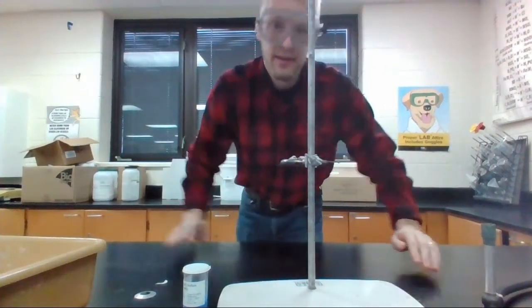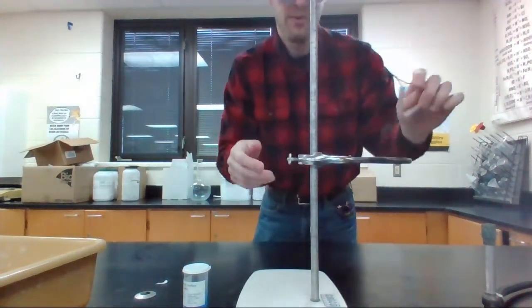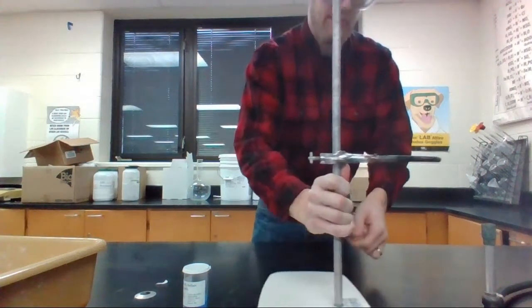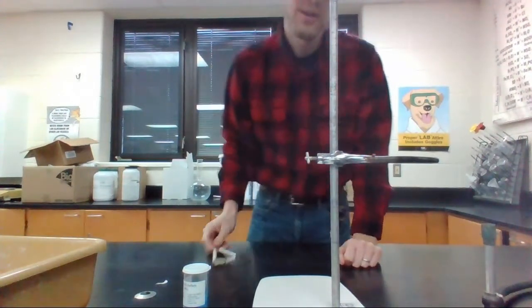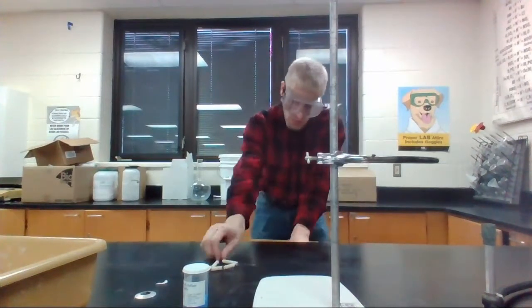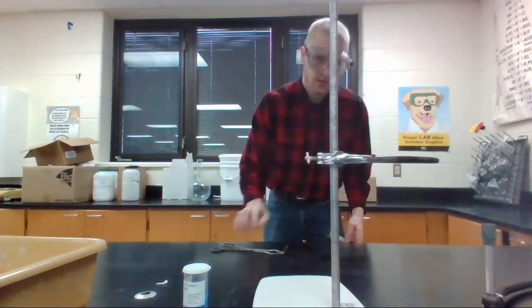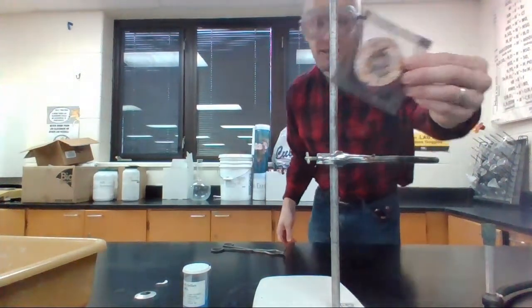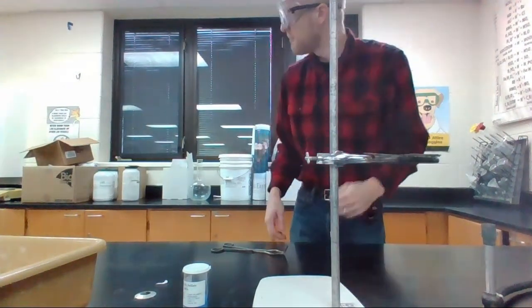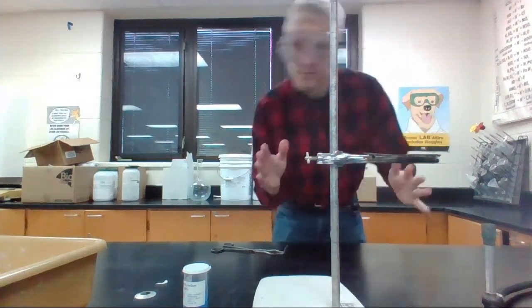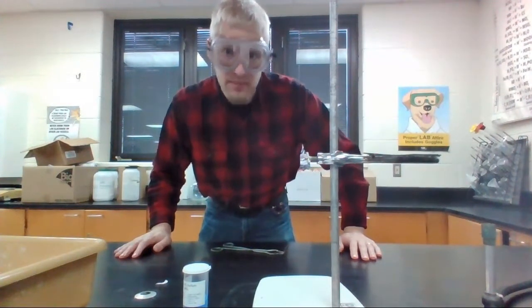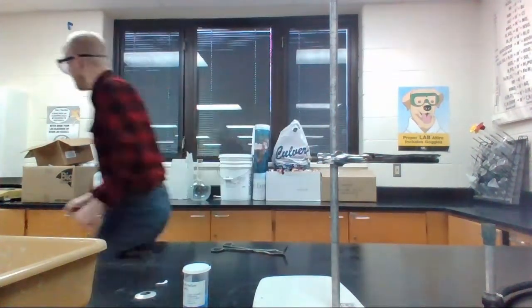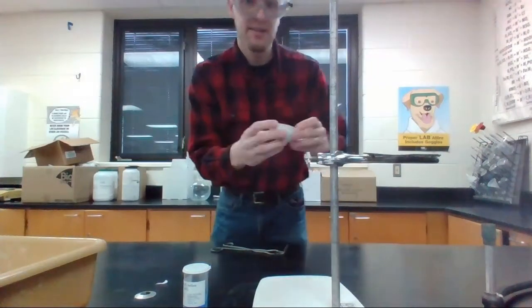Look at this setup. We have a ring stand. Let's put it so that you can see it. We have right here's a ring. And that's where we have this triangle, but that's more for crucibles. So there I am. We're going to get a wire mesh, which looks like this. There it is. Wire mesh. I'm going to put it right on there, because that way my evaporating dish, there it is, will be able to stand on it without falling. So I'm going to get the evaporating dish. Here it is. Evaporating dish.